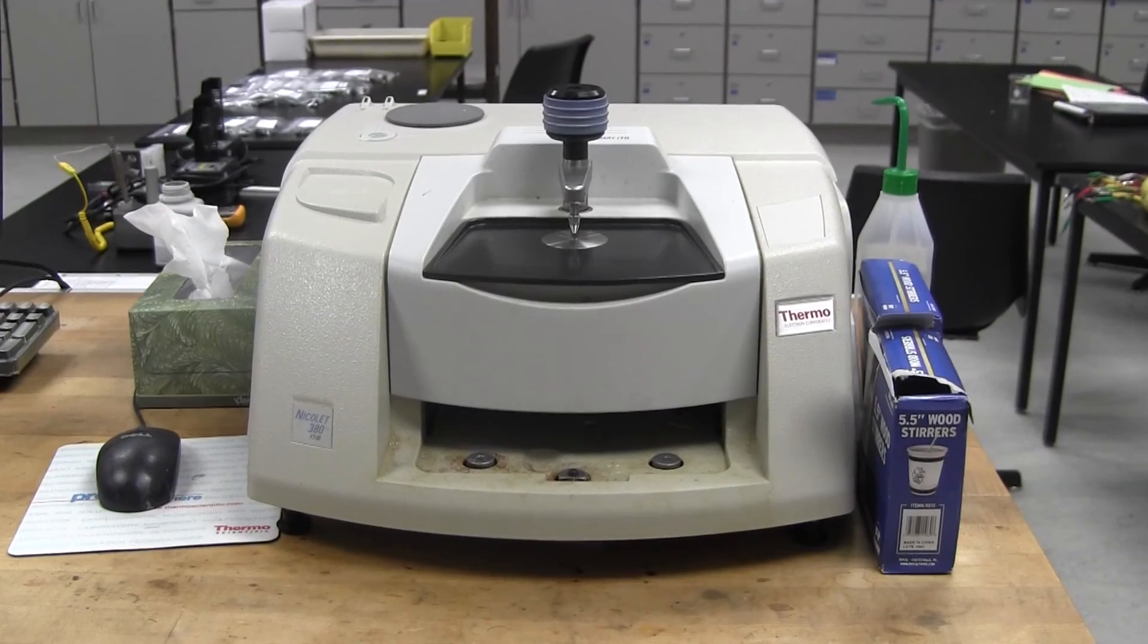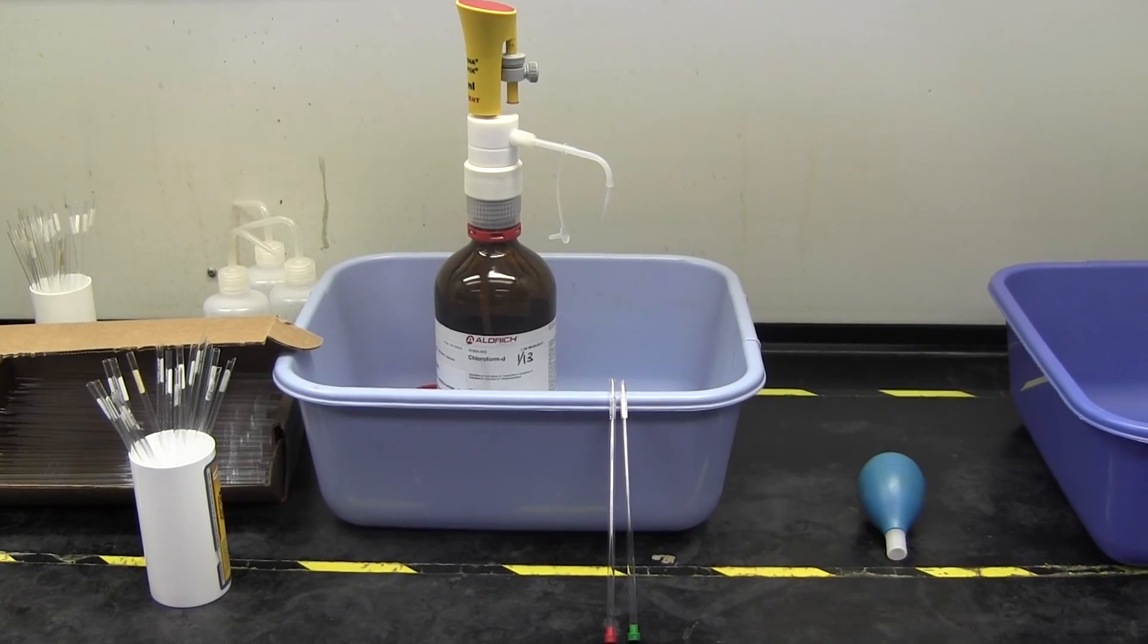Finally, re-weigh the vial and collect IR, proton NMR, and melting point data.